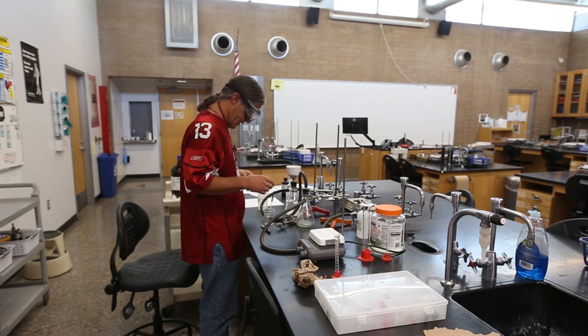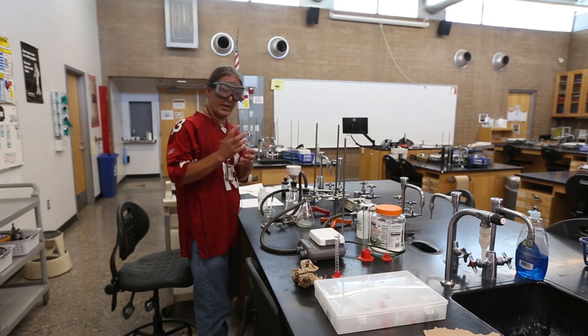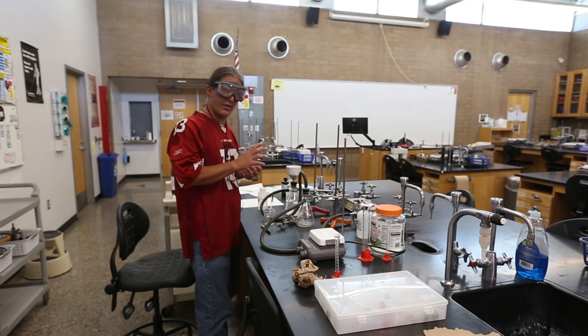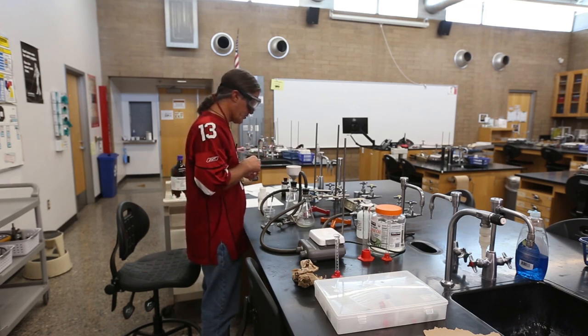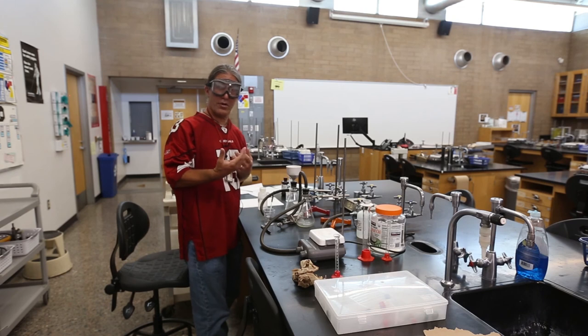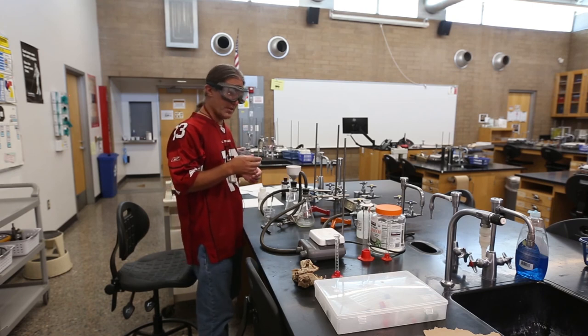There may be a lot of sodium hydroxide trapped in here — I'd love to get a pH on this soap solution, because if there's a ton of sodium hydroxide in there the pH would be like 13 and it'd be corrosive. If most of the sodium hydroxide has washed out, the pH won't be very basic and it'll be more comfortable for our hands and better for long-term use. But there we go — we've filtered and isolated our soap. We would normally mash it up and wash it again with ice water to get all the sodium hydroxide out. We're going to test the properties of the soap solution we made and compare it to a commercial soap product to see how our soap compares.